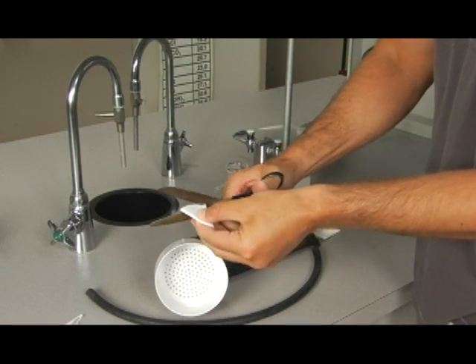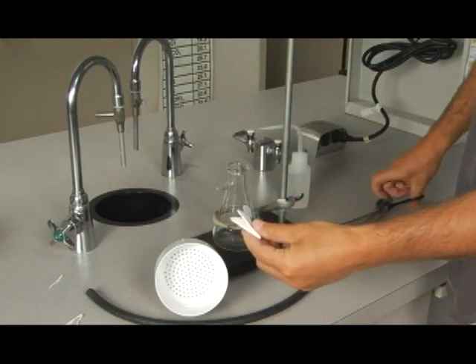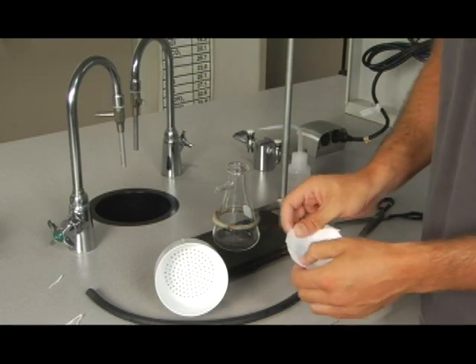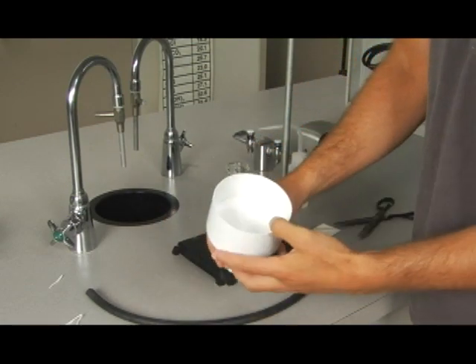Just from experience, I don't think that's quite enough. There we go. What we're looking for is a piece of filter paper that will cover all of those holes in our filter. Excellent.